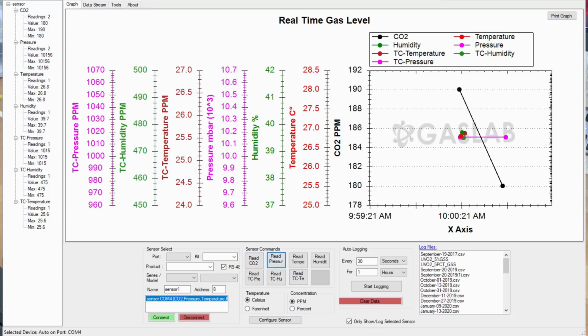And now we're going to connect another sensor to it. Again, we're on COM 4, again, we're RS485, and again, we are with an EC MX series sensor. And this one is going to be the diffusion one, and it happens to be on address 6. And so we hook it up, and here we go.